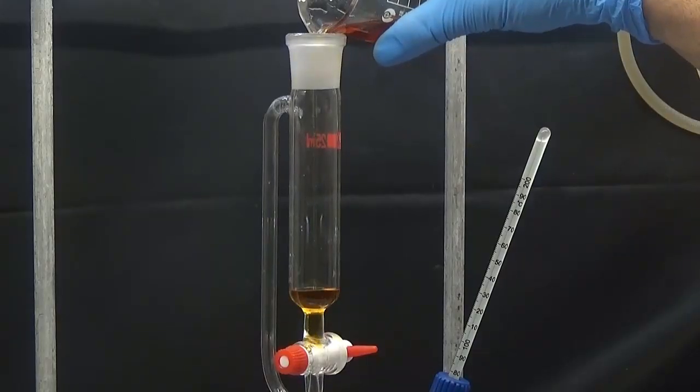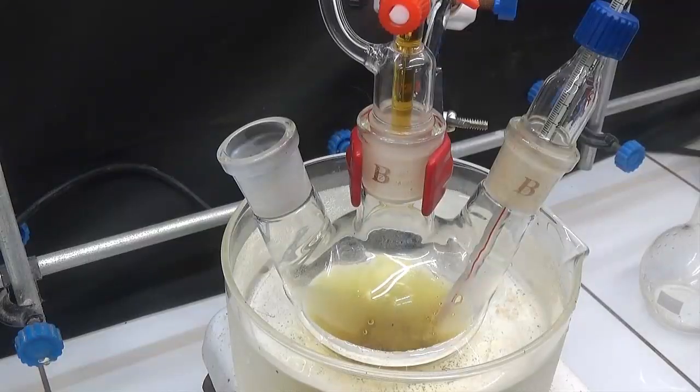In this video, we will see how to make a synthesis of 7-hydroxy-4-methylcoumarin.